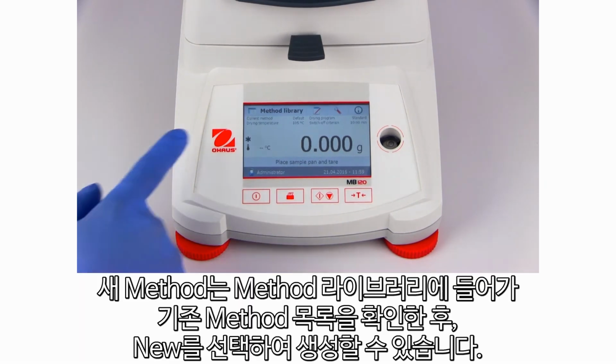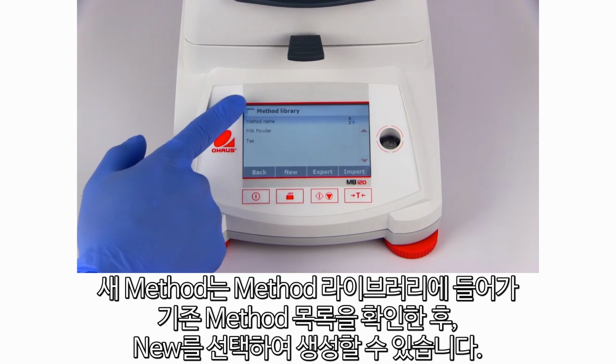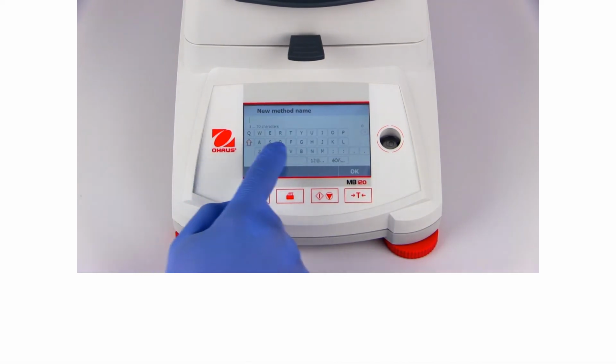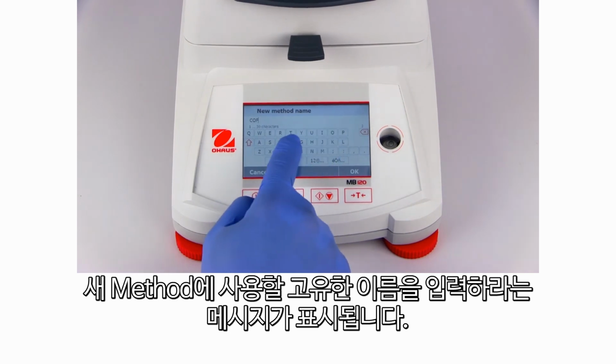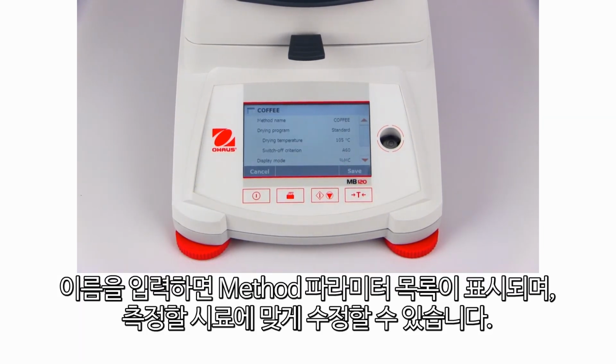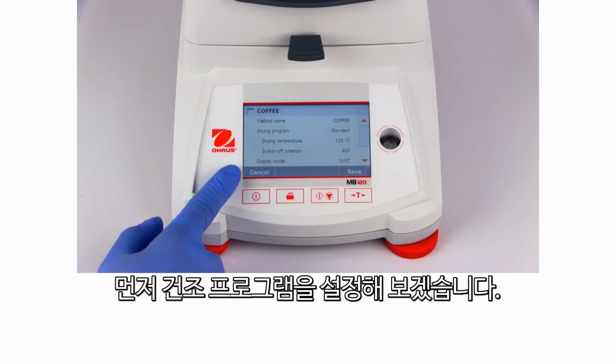A new method can be created by entering the method library where a list of existing methods is shown and selecting New. You'll be asked to enter a unique name for the new method. Once a name has been entered, a list of method parameters will be shown that can be modified to best fit the sample under test. Let's start by setting the drying program.